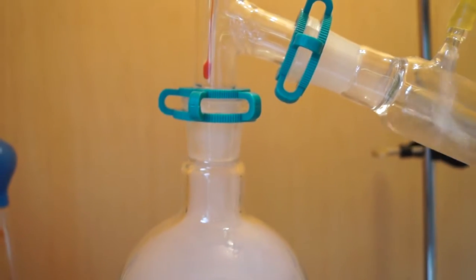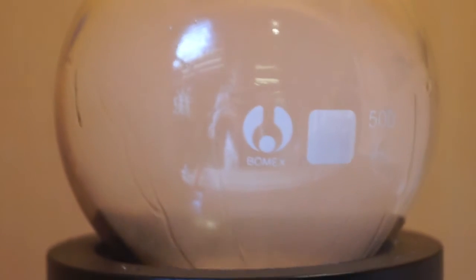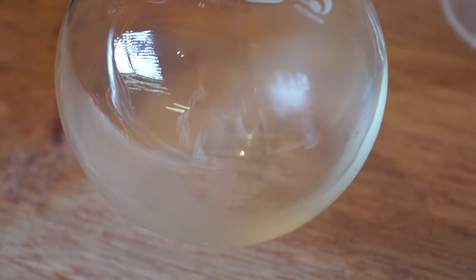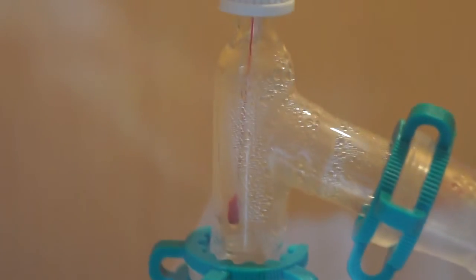The acetic acid started to evaporate in my boiling flask, creating a white mist. Any sulfuric acid that evaporated condensed on the side of my boiling flask. After a while, my first drips of glacial acetic acid were seen. I continued heating my mixture until I was sure that no more acetic acid was left in my boiling flask.